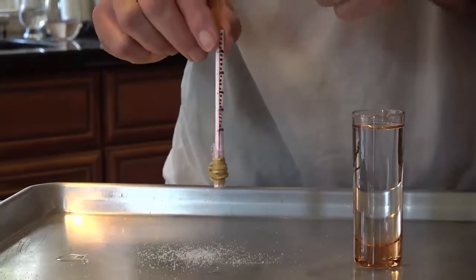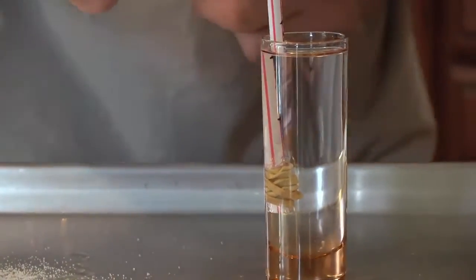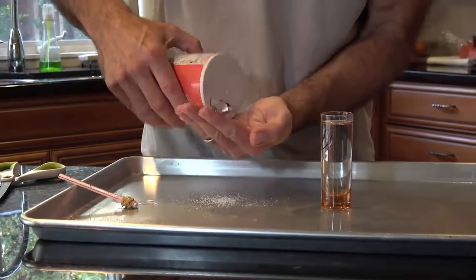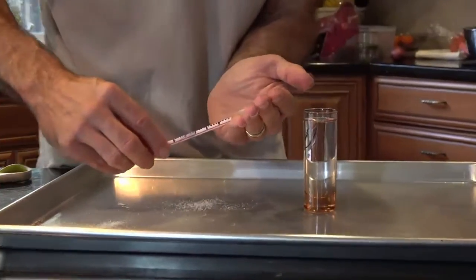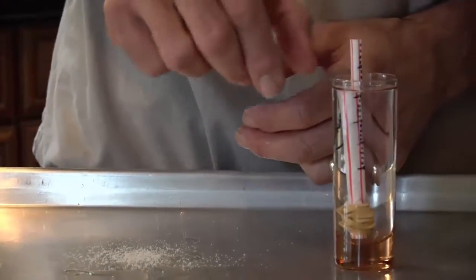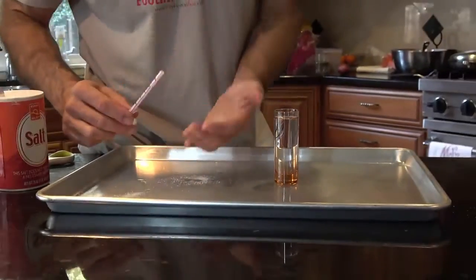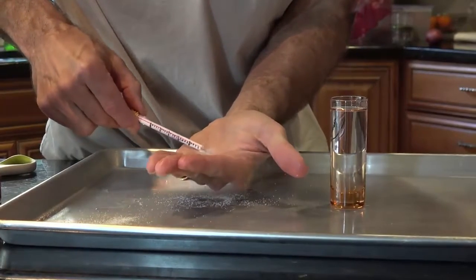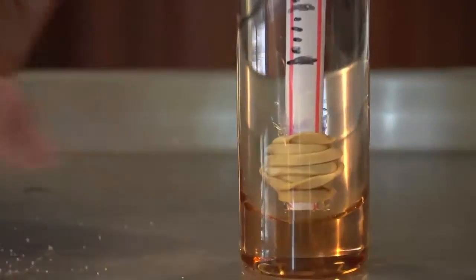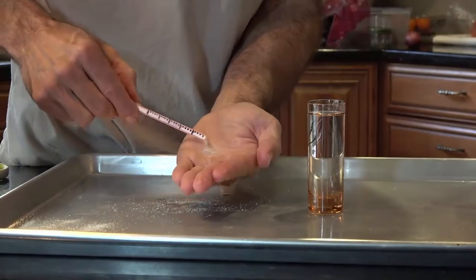All right, let's try again. We don't want to get any liquid inside our straw. It's getting there, and you probably could get a little bit more salt in there. We'll see, maybe that's too much. See, it's touching the bottom now, so I put a little too much salt in. I'm going to shake just a little bit out. Okay, and we'll try it again. It's still touching the bottom. I'll shake just a little bit more out. Doesn't take much.